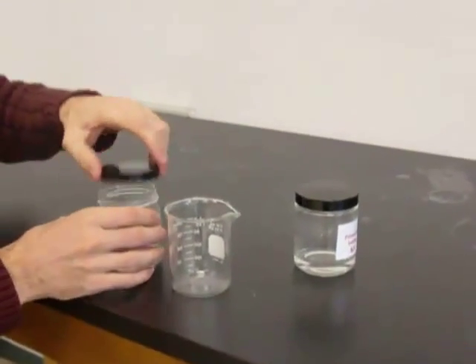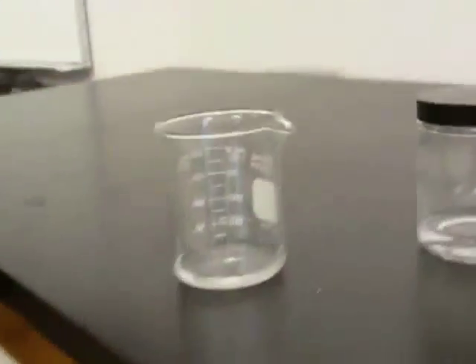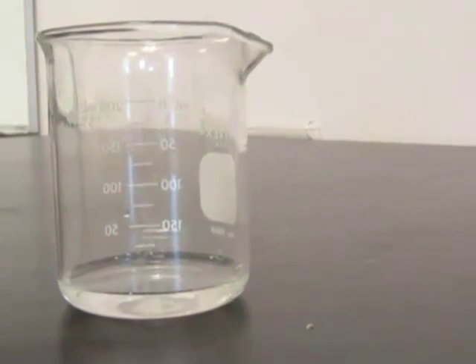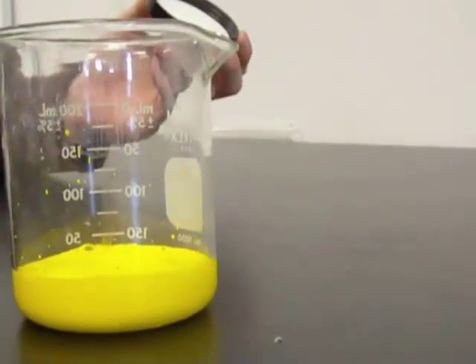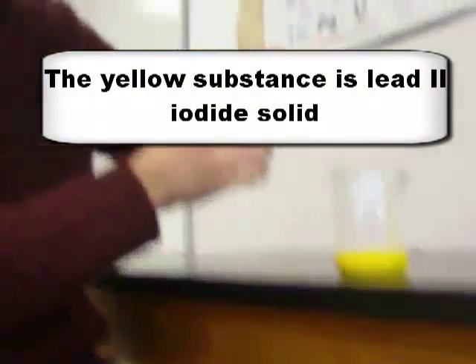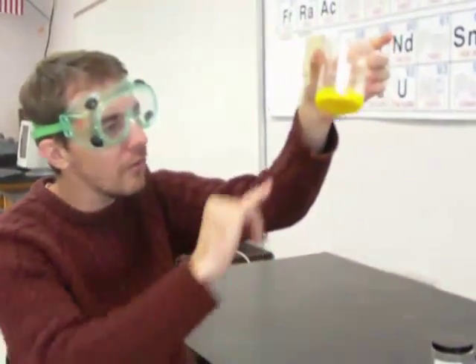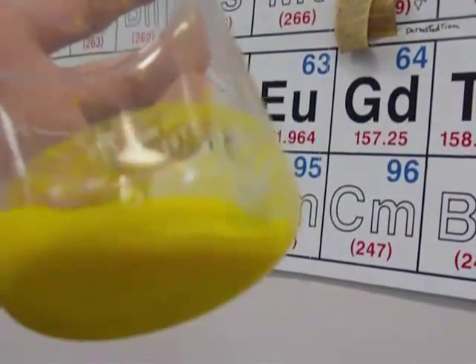So I'm going to add a little bit of lead nitrate to my beaker here, and then I'm going to add some potassium iodide. Whoa! Our two clear and colorless liquids form a yellow solid. You can see that it's a solid — not a yellow liquid — you can see chunks settling down to the bottom. We call that a precipitate.